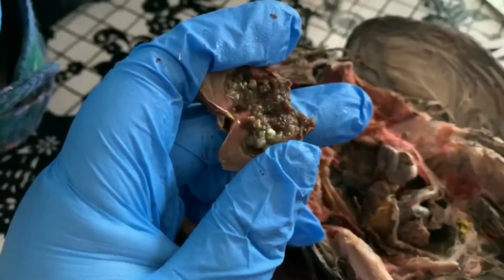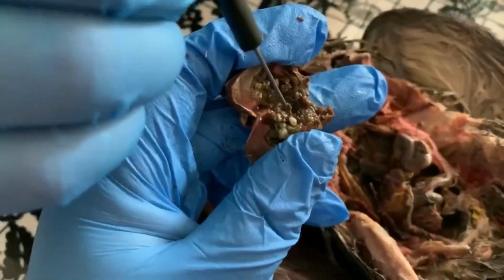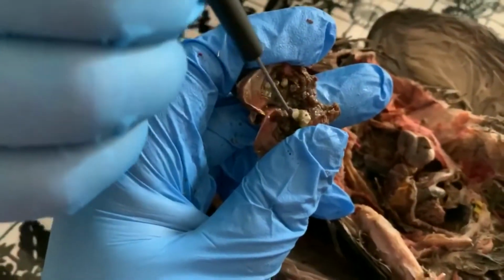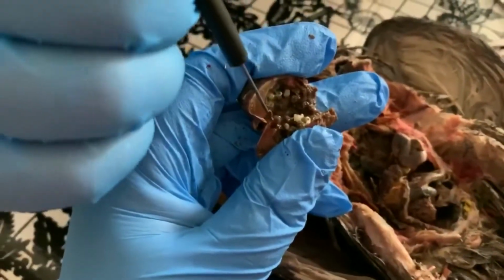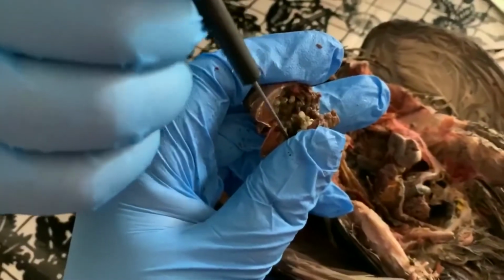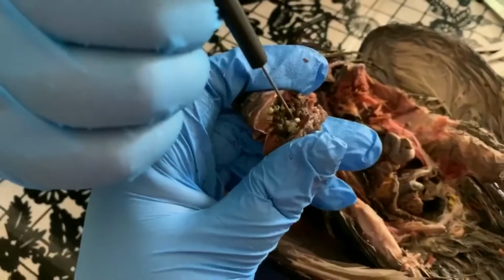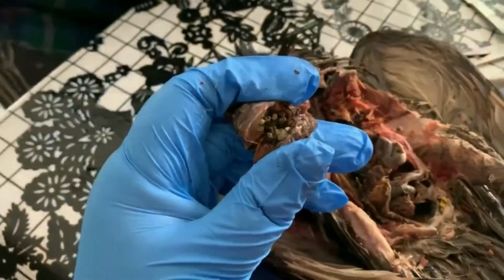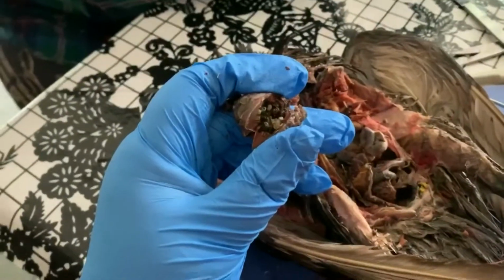Again, looking at the gizzard, you can see we've cut the gizzard open and you can see the rocks that are inside. The purpose of this hard gizzard is to help grind up those seeds. Some of it being rock solid is because it's muscular, but some of it's truly because it's filled with rocks. Just interestingly, chicken gizzards can be viewed as a delicacy sometimes.